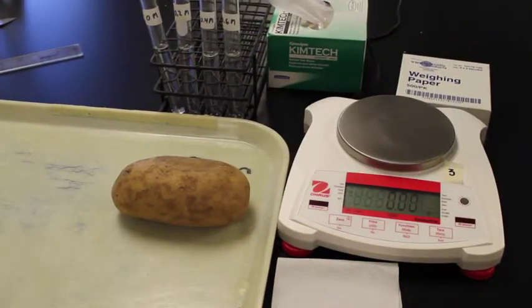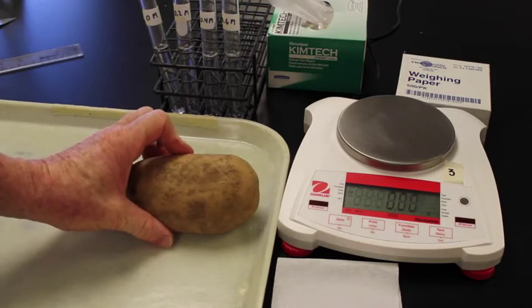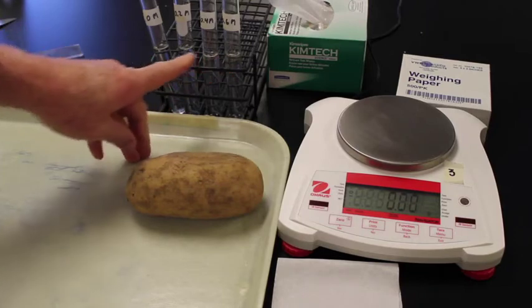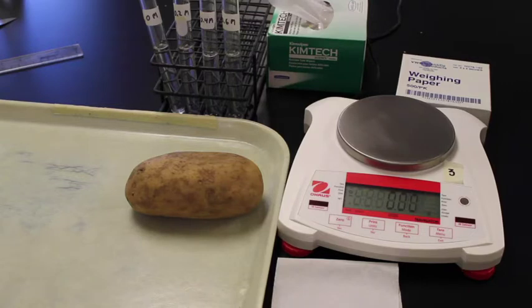Before we run this experiment, I want you to think about the experimental design. What I really want you to think about is how to control the possible variables that are going to be influencing the various factors. We have a potato. We're going to be cutting cylinders out of the potato. We have four different salt solutions. We want to think about controlling all the variables associated with those. We're going to be massing the cylinders. So I want you to think about all of the potential variables that could be influencing it and how we're going to control those with the experimental design.